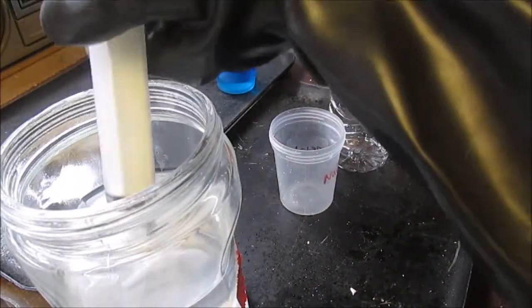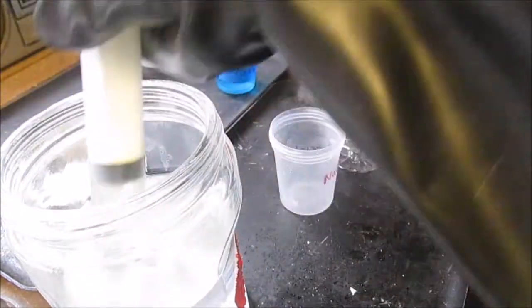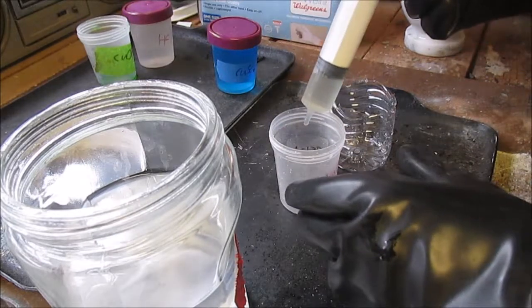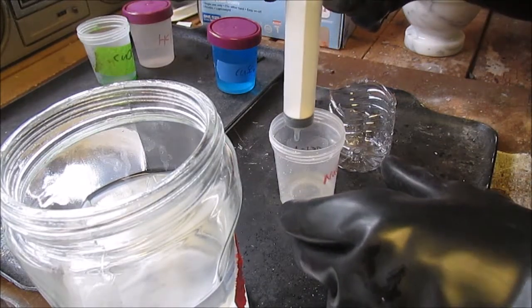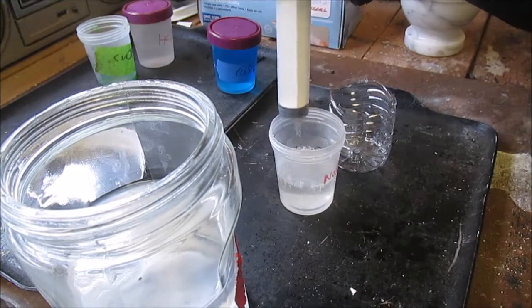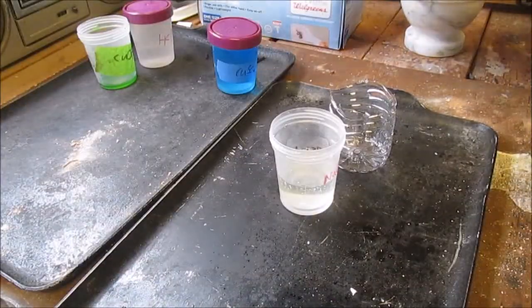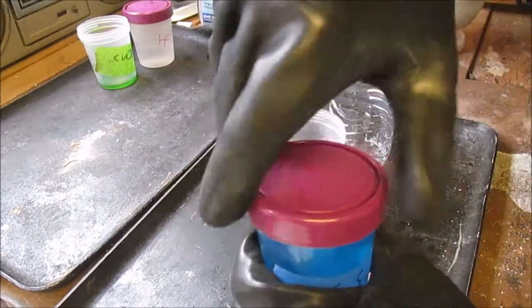I made a very concentrated, I made a basically super concentrated stuff here. Sodium hydroxide, so I got some of it there. And then I'll just put it in there.